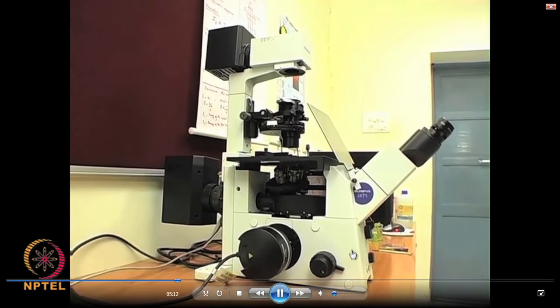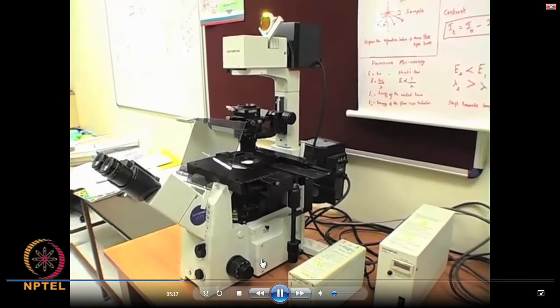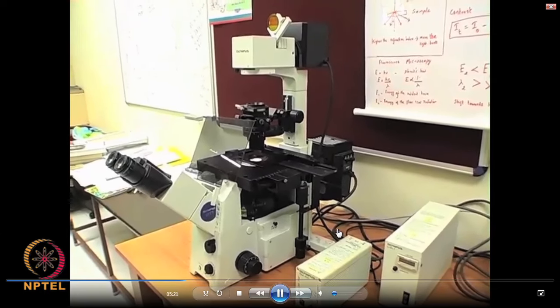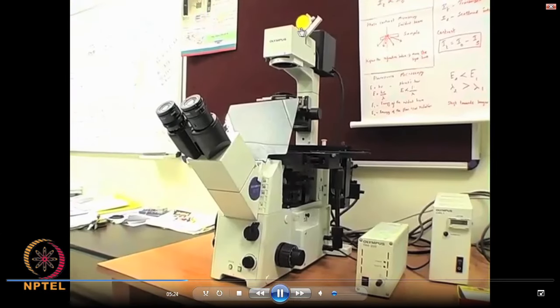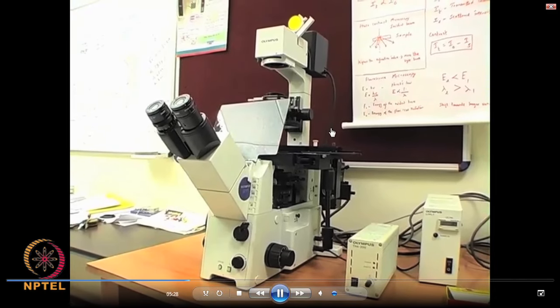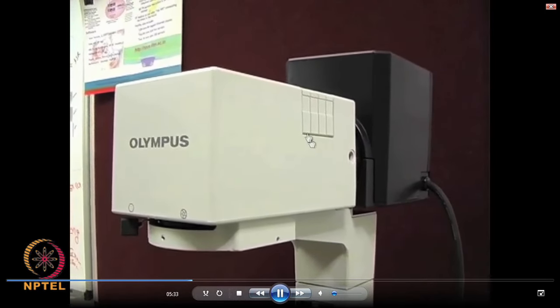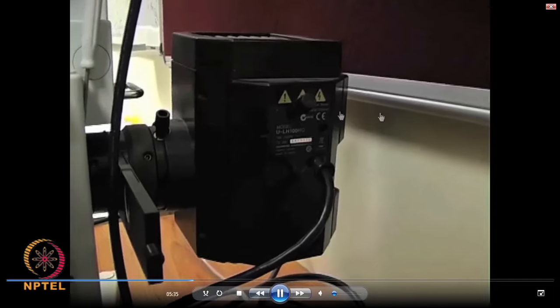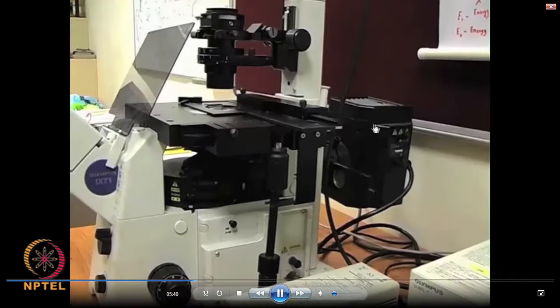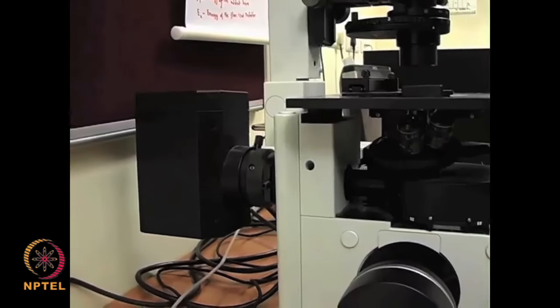Now, this is where I just left in the last class. This is an optical transmission microscope which has got two illuminating systems — one is a halogen lamp and the other is a mercury vapor lamp. These two are just used for specific applications, which I will mention whenever applicable.